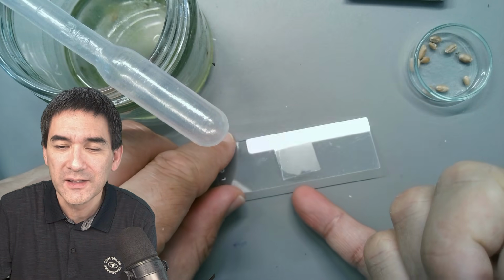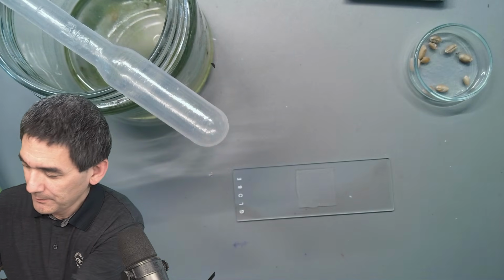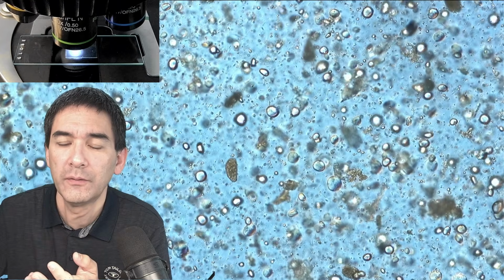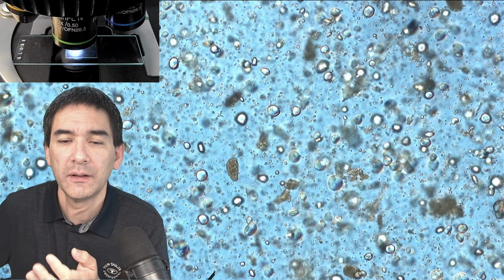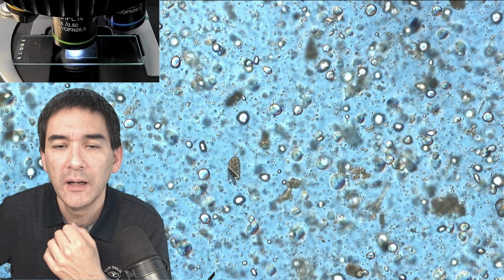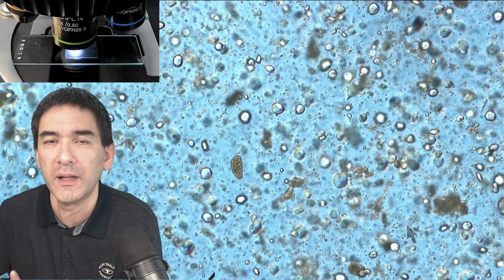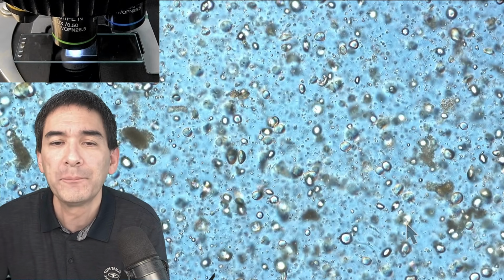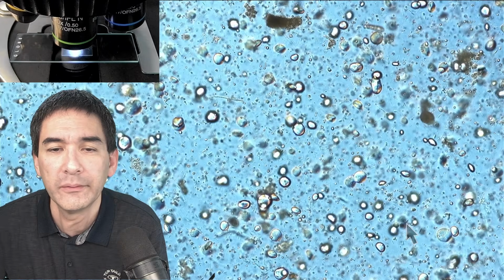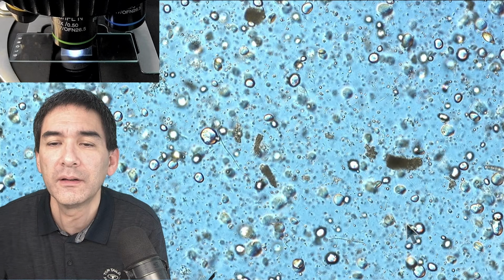Look how thick it is. It spreads slowly. And let's have a look now. Okay. Yeah, and this is what we get. Multiple problems. First of all, way too much of the specimen. But look, this might actually be a cell here, right? We don't see any movement, obviously, as expected, because the methylcellulose is doing its job. But the second problem is that there's simply too much material on here, right?